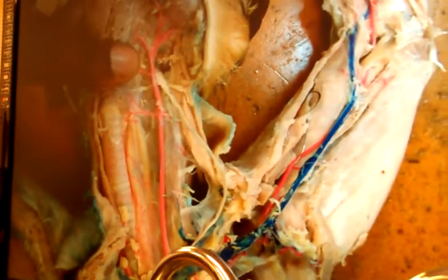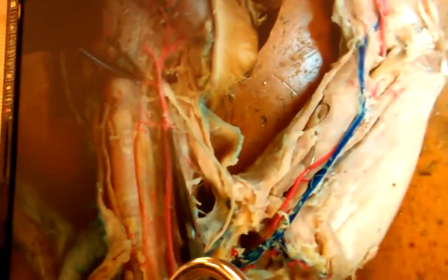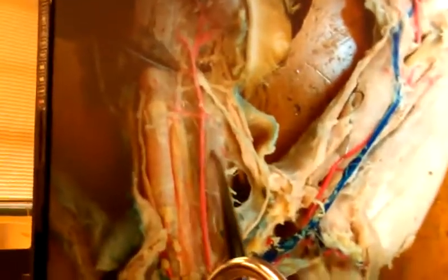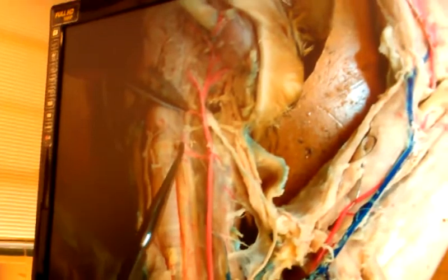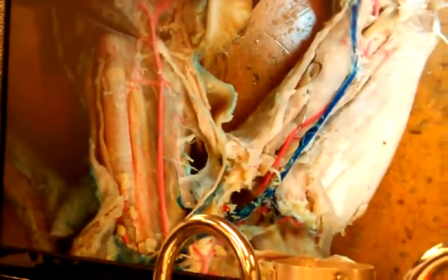What do you mean? Because the roadmap is already in my head, and so I already know where the structures are going. I come up to the left subclavian, Mr. Gilmore. Left common carotid. The left common carotid gives off this first vessel. His name is what? Superior thyroid. Opposite superior thyroid, Mr. Gilmore, is this one, but this is a big, large muscle. And there is an artery that goes to it, so what are you going to call him? Muscularis. So, Mr. Gilmore, the rule of thumb for me to remember is this is superior thyroid first, and opposite of him is muscularis.